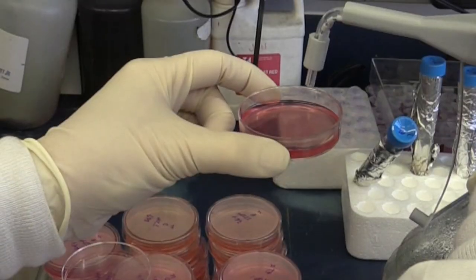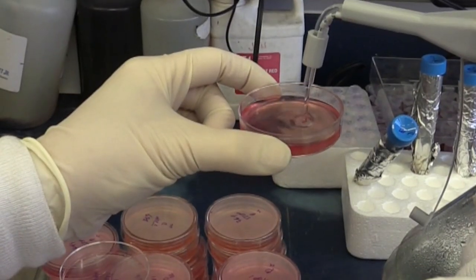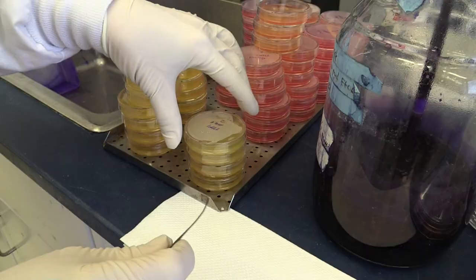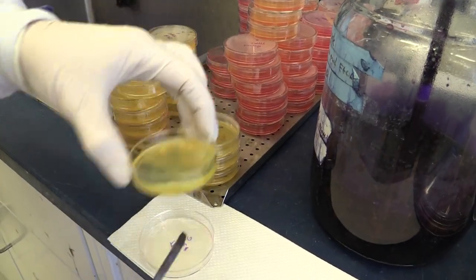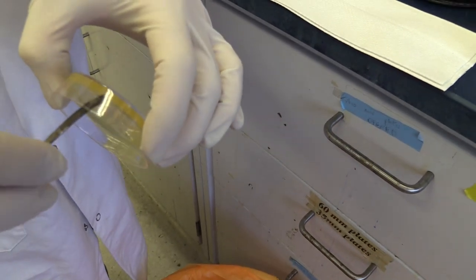After the correct incubation period, we remove the plates from the incubator, and we add a solution of trichloroacetic acid to the plates to fix the cells to the plastic. This makes sure they don't come off in the next step when we remove the agar overlay.